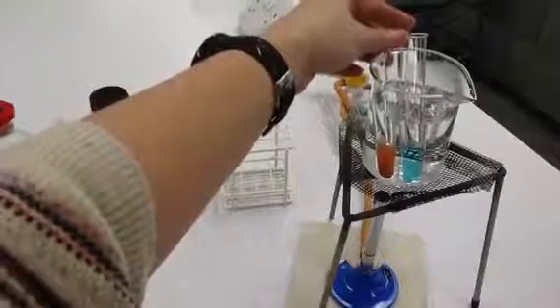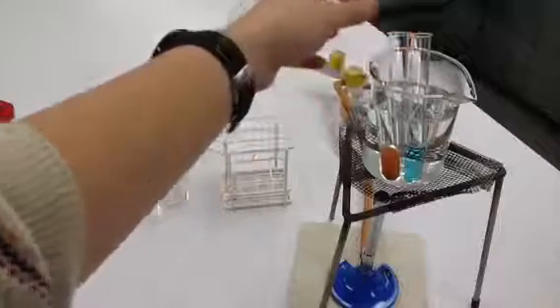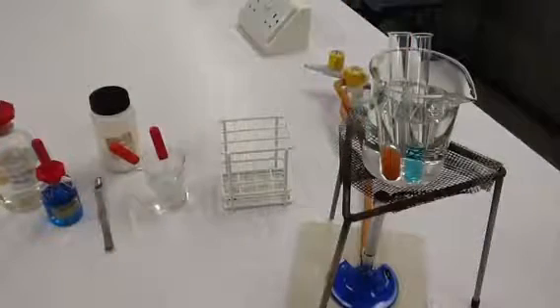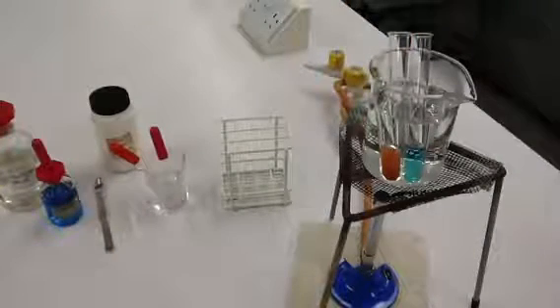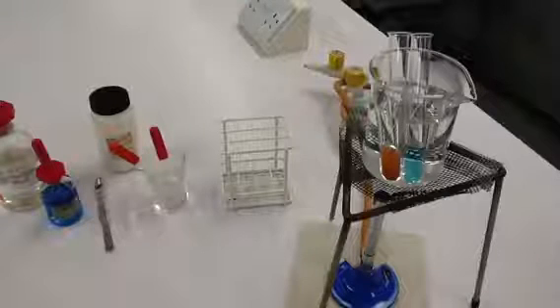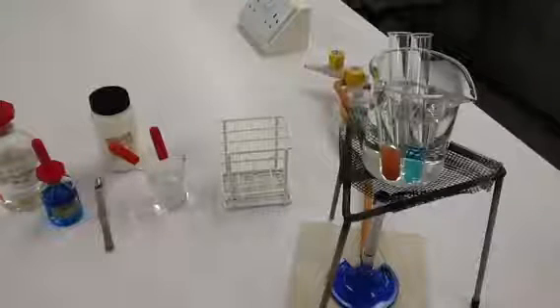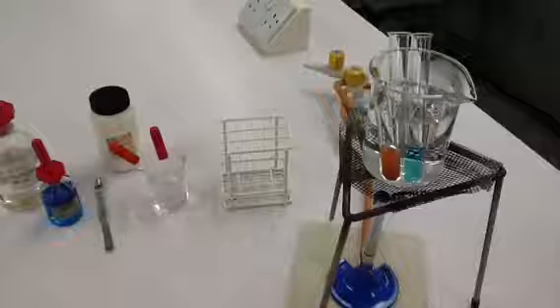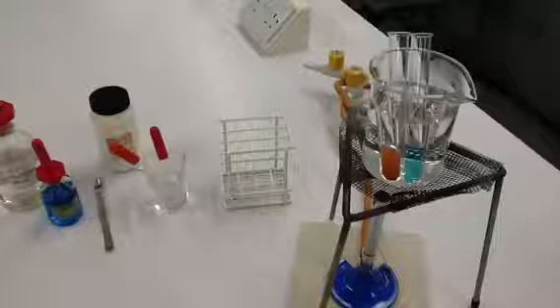This indicates that sample B was in fact a non-reducing sugar. And the non-reducing sugar that you need to remember for your exam is sucrose. So sample B must be sucrose. There are no other non-reducing sugars that we see.